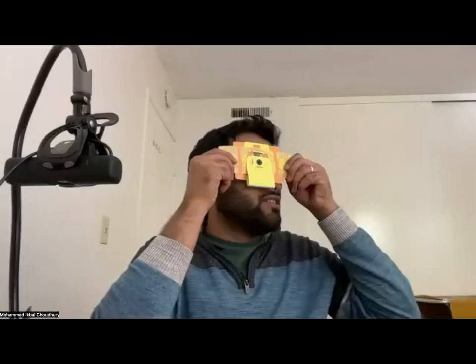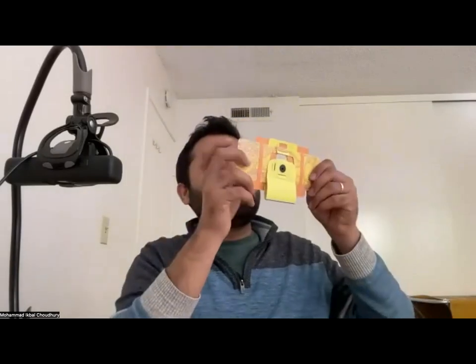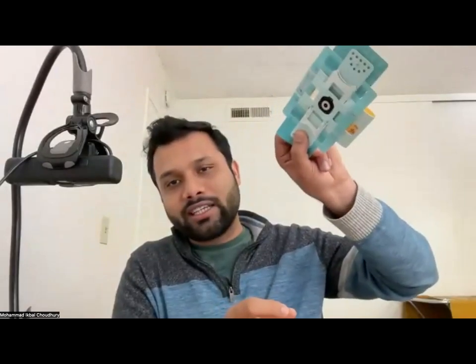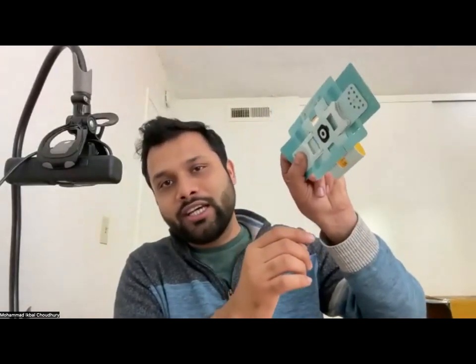If you can't see anything, that means that your lens is either far away or too close to the sample. So try moving the wedge, holding it with your fingers like that, so that while moving the wedge, you don't move the XY really fast.